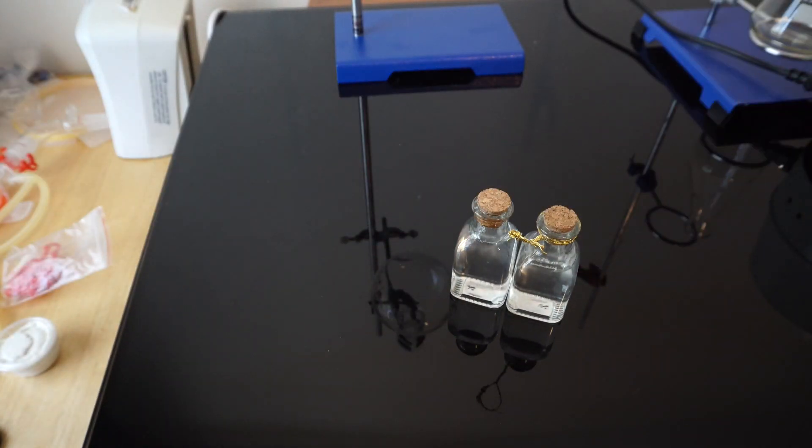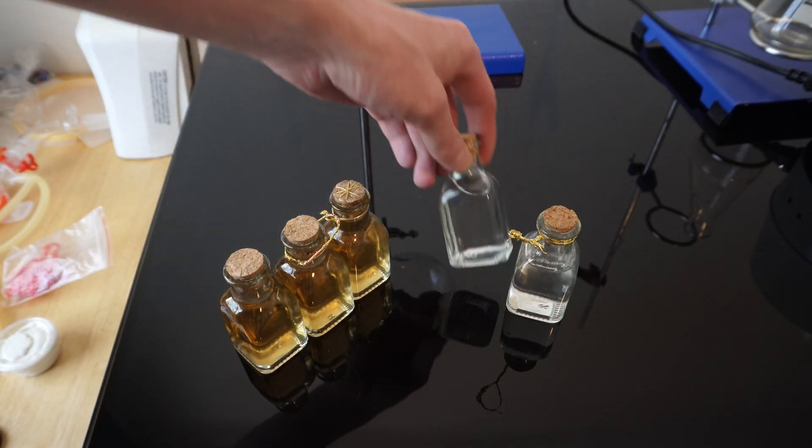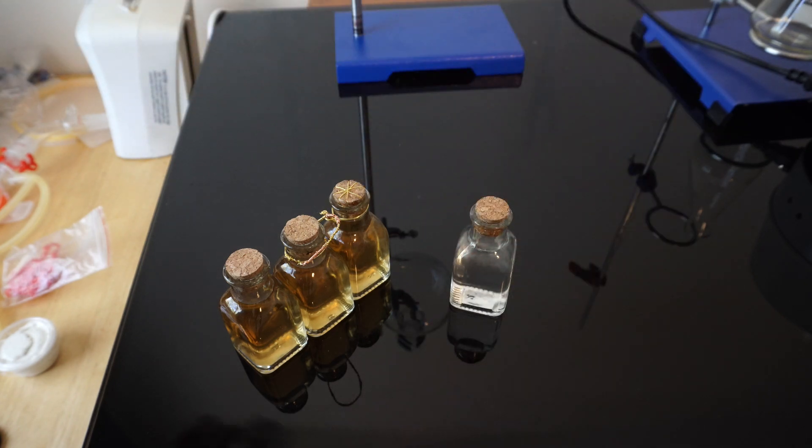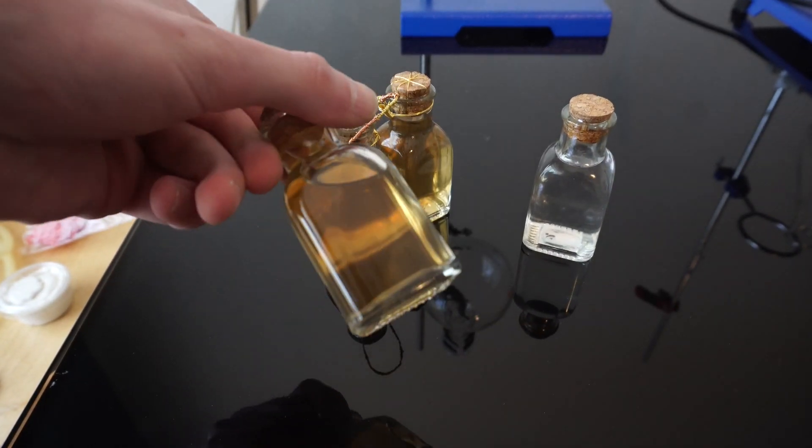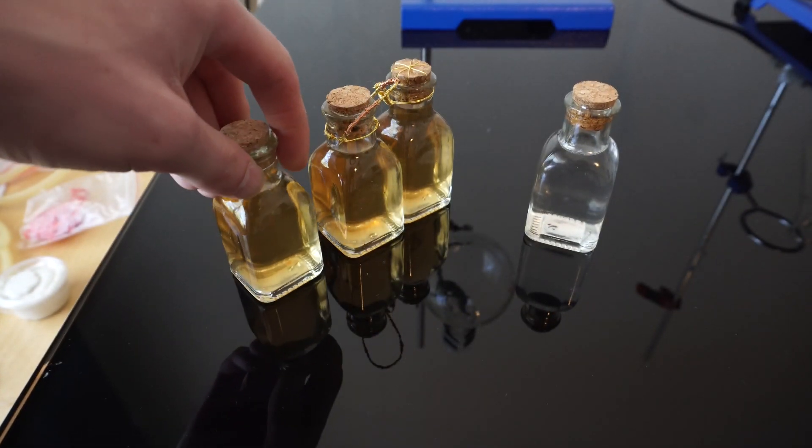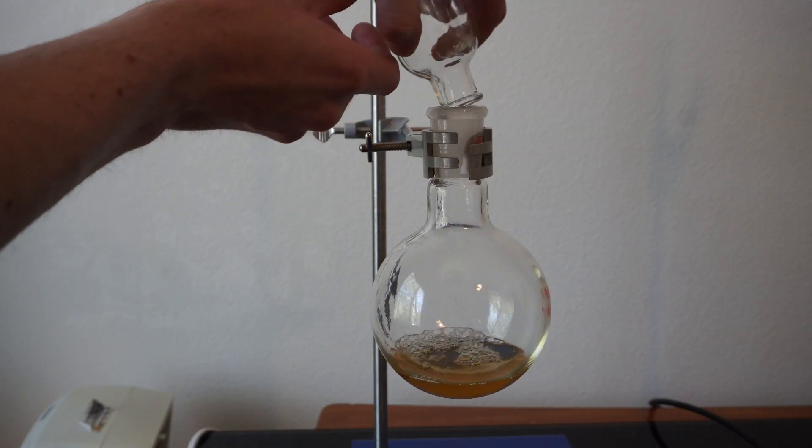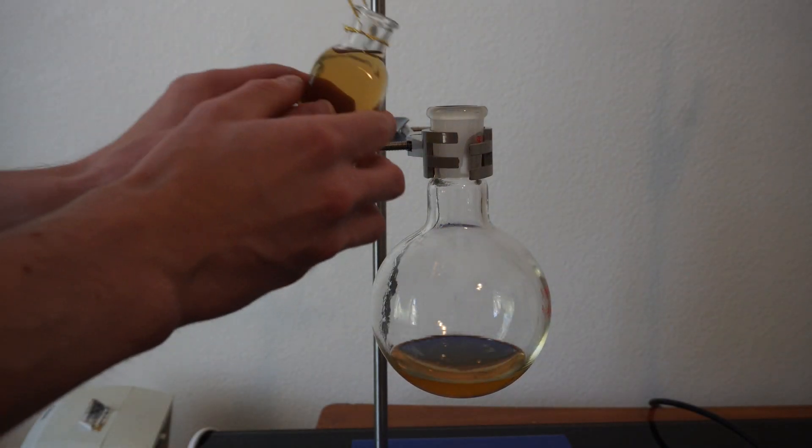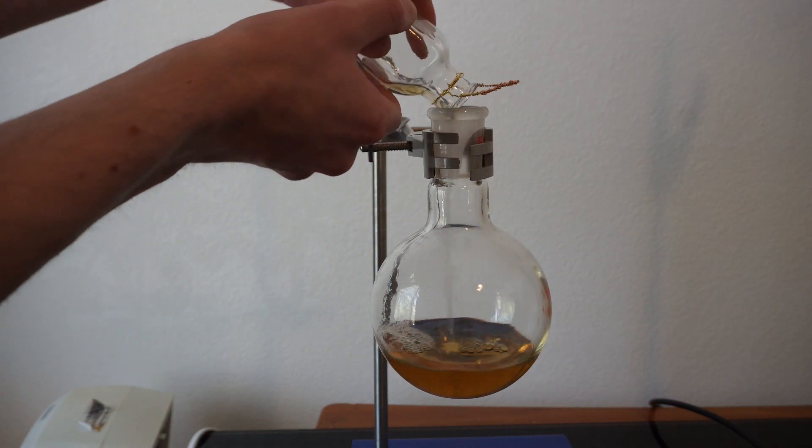Hi everyone. In my last video, I used the method of hydro distillation on rosemary plants and ended up with a clearish hydrosol at the end. However, I ran this a few more times and noticed I was still leaving oils behind. In my more recent batches, I was able to get more of the oils I left behind, which resulted in more of a greenish olive oil looking mixture. Today, I'm going to further refine that oil by distilling most of the H2O from the hydrosol mixture and see if we can't end up with a scent profile that matches our rosemary.